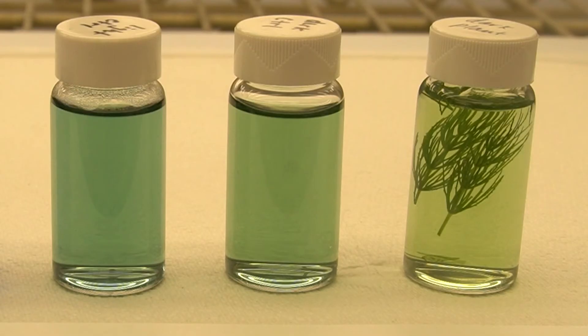On the other hand, our plant vial in the dark turned more yellow. All life on Earth respires, and in the absence of photosynthesis, plants will be net producers of carbon dioxide due to respiration. The resulting acidification of the water made the BTB yellower.